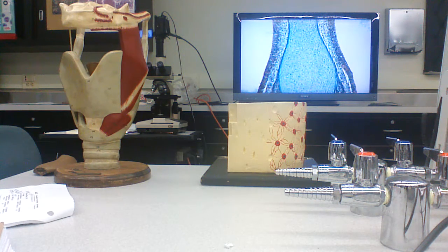At the same time, the new bone that's being formed is being eroded, and the periosteal cells out here are combining with blood capillaries and blood vessels and building compact bone on the shaft. Okay?